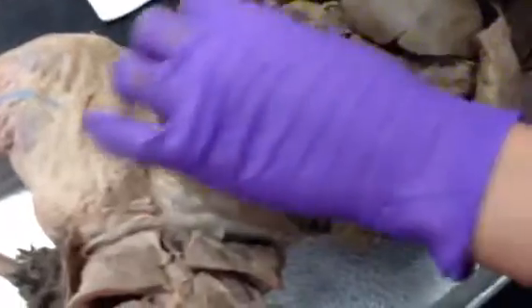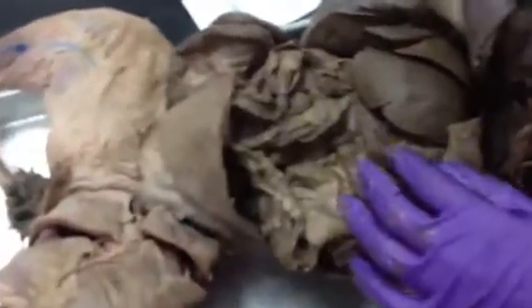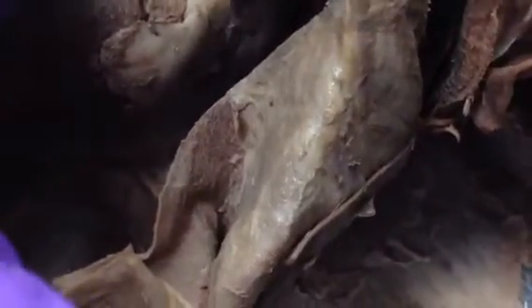And then the other mesenteries, like the gastrosplenic ligament, is between the stomach and the spleen. So it's here, just between the stomach and the spleen. It's more definitional. Here. And then the gastrocolic ligament is between the stomach and the colon, which is here. So it's harder to see, but it's just between the stomach and the colon, and it's also more definitional.